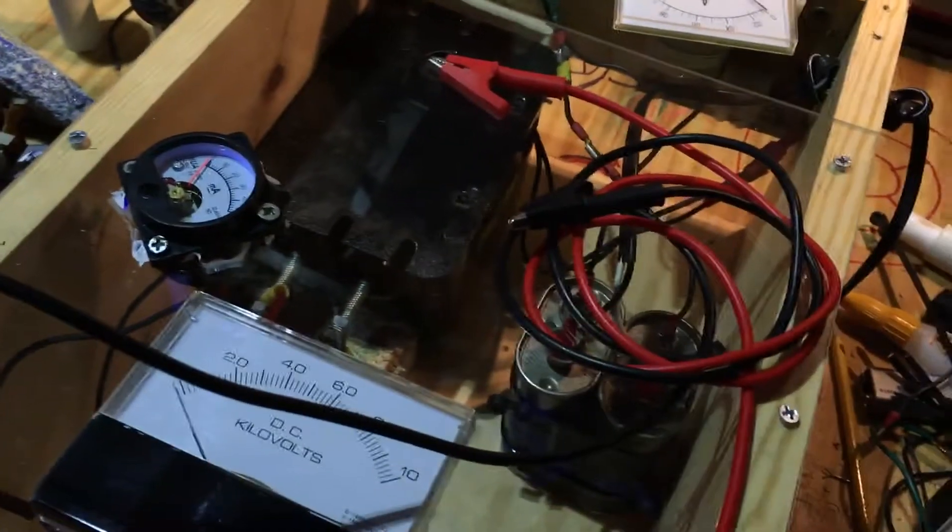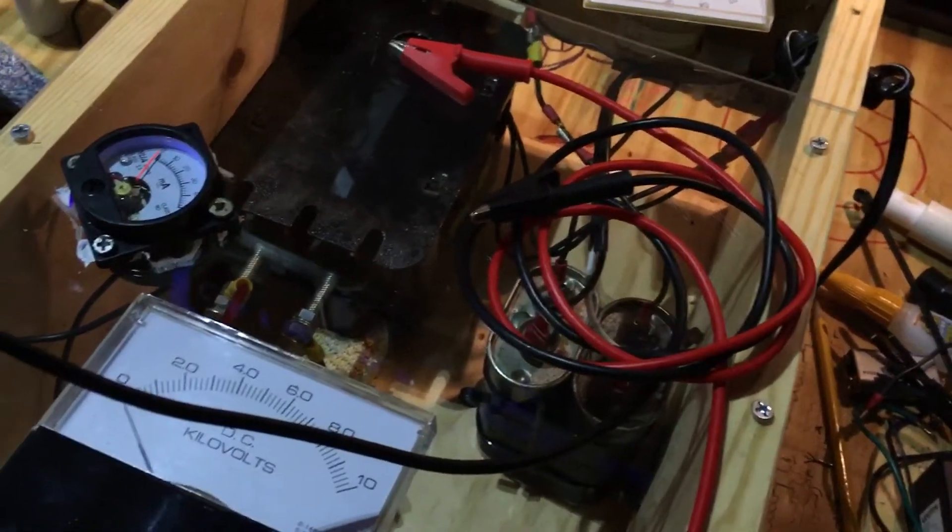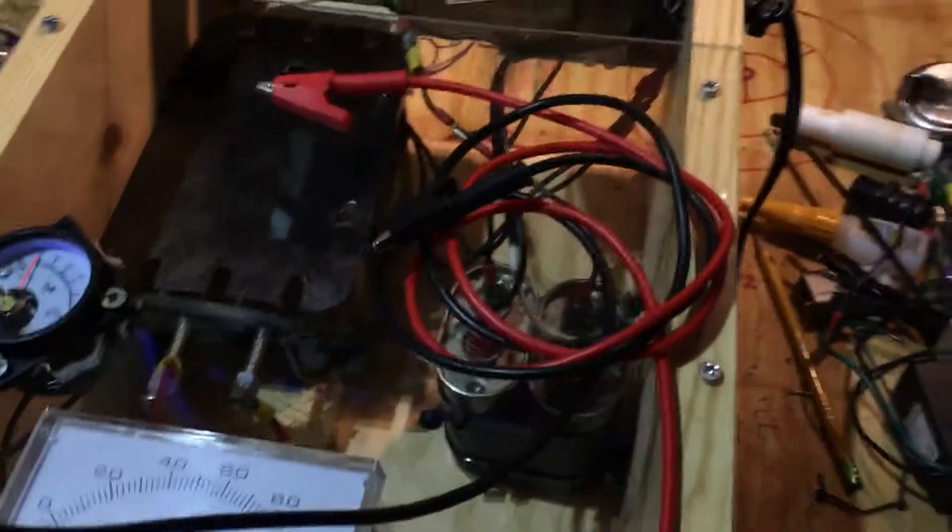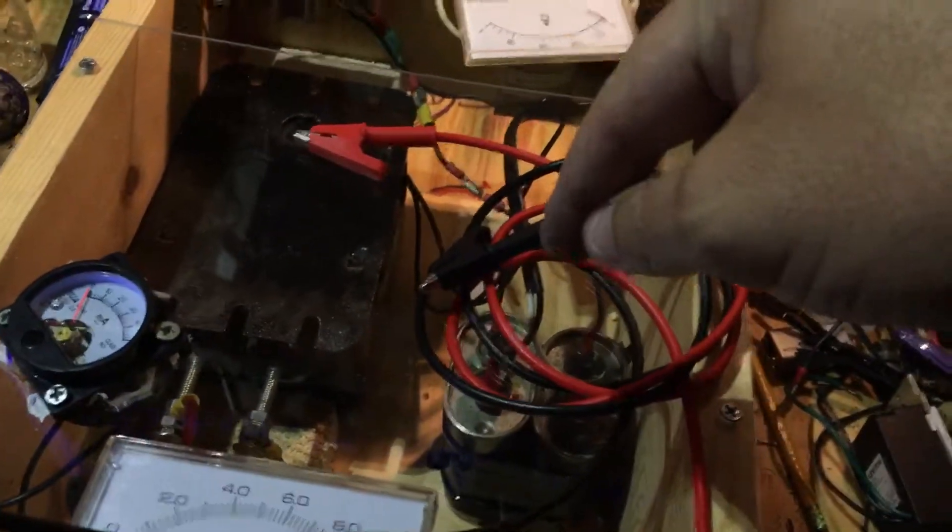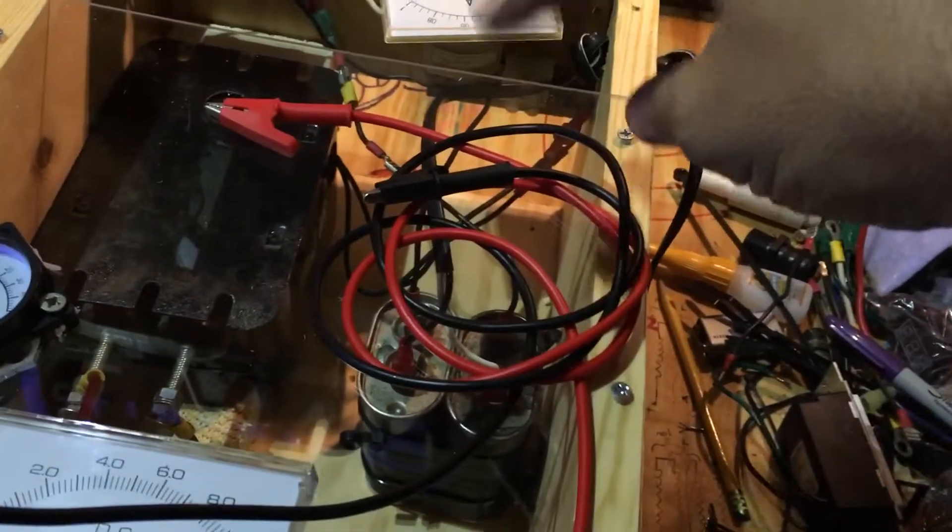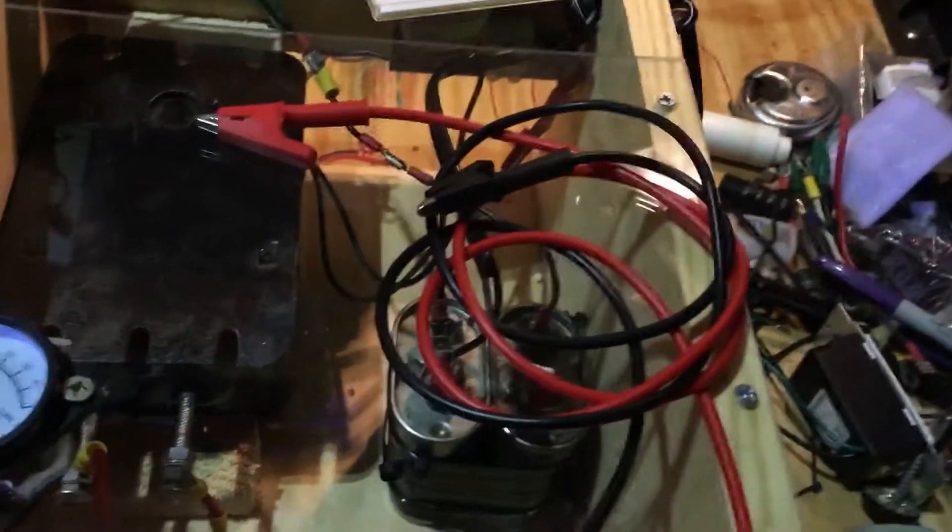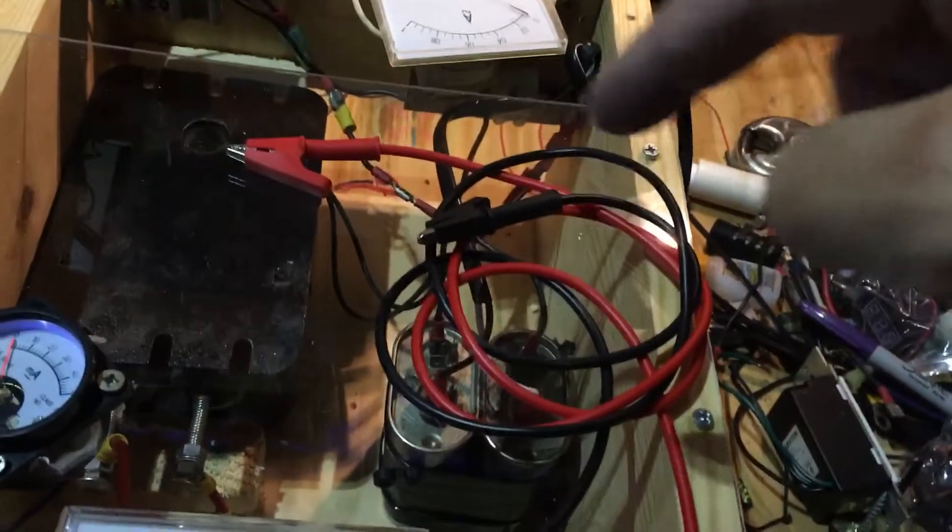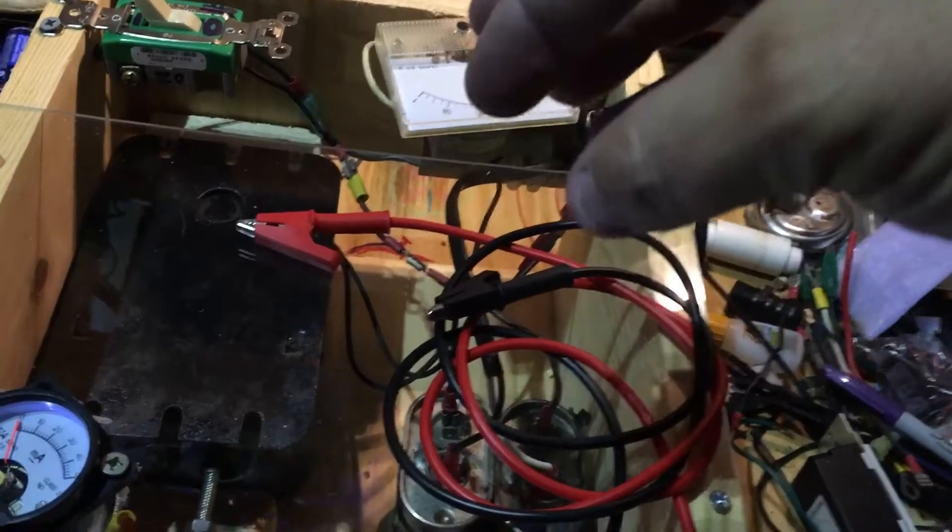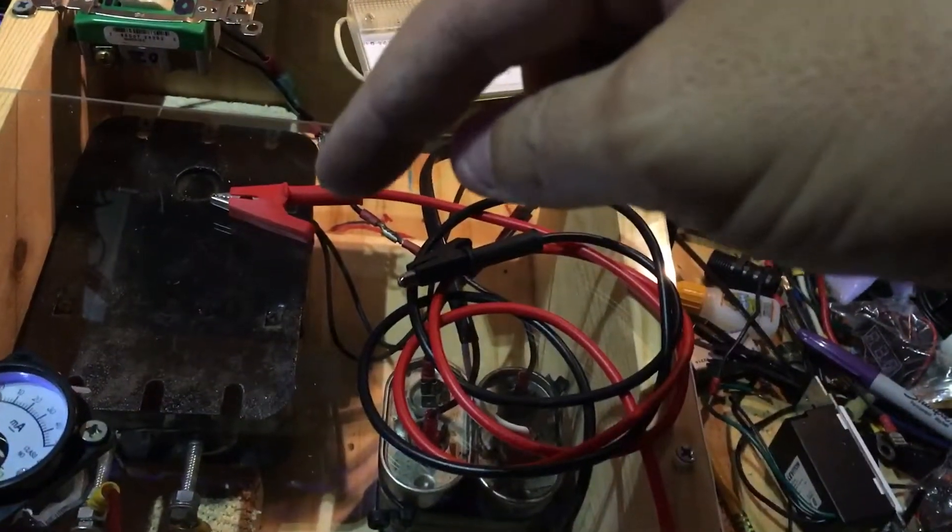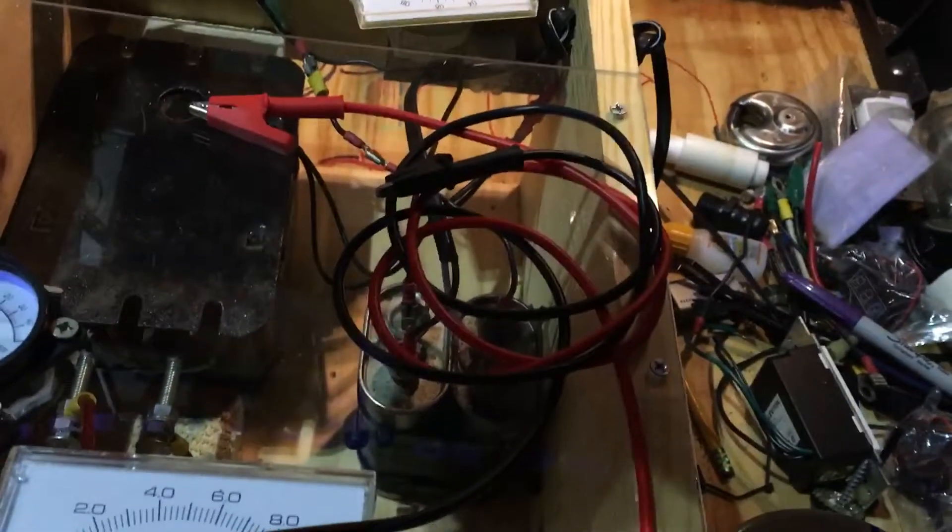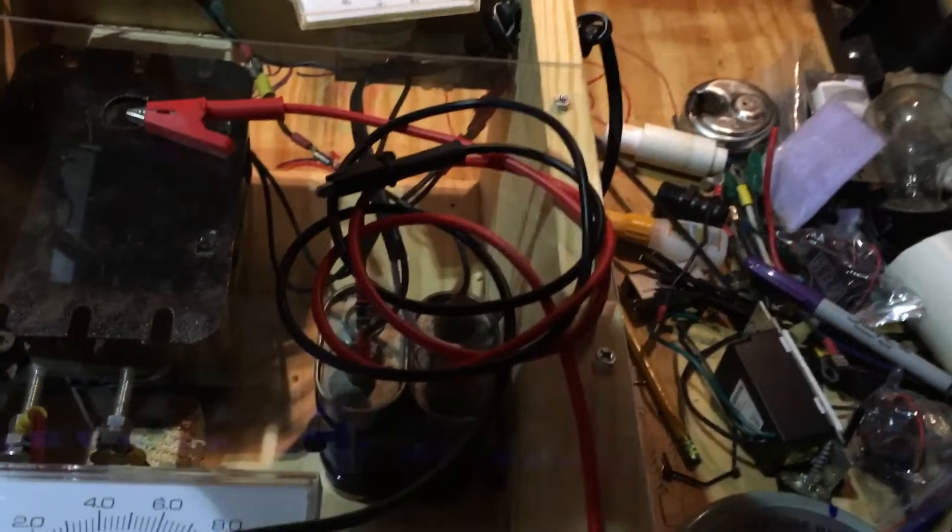So as far as I'm concerned at that point, you're going to want to have just a clear space that has no metal near it, at least on top of like an inch thick wood or something that gives you a decent insulation. Because you're going to just put the plate on top of whatever that surface is and connect this to that surface. Don't do marble or granite or anything that might have conductive properties inside it. Marble's probably okay, but granite probably will have conductive. And then you would put the petri dish on top of the bottom plate that's connected to the black lead. And then once you put your seeds in the petri dish, you put the other plate on top and you connect the red lead to the far side on the opposite side, but to the top plate.